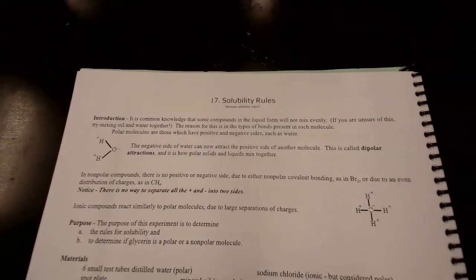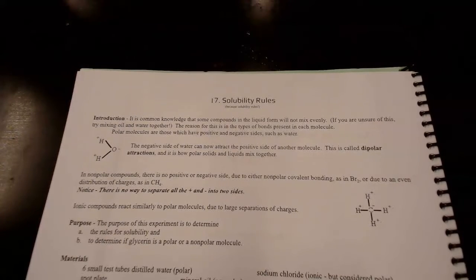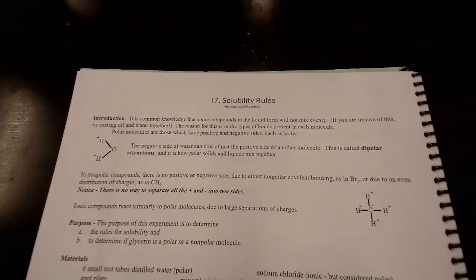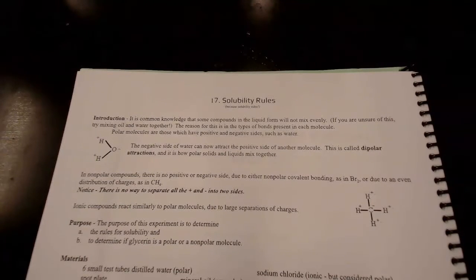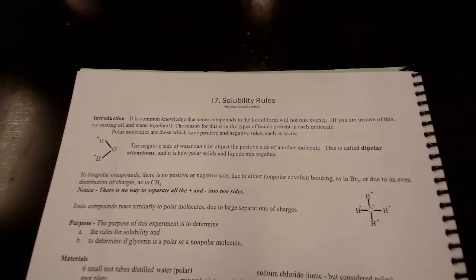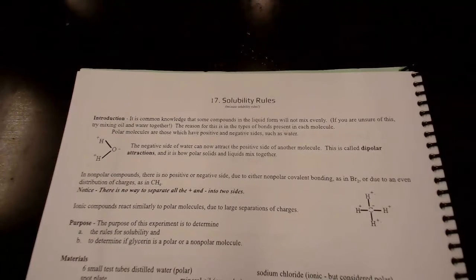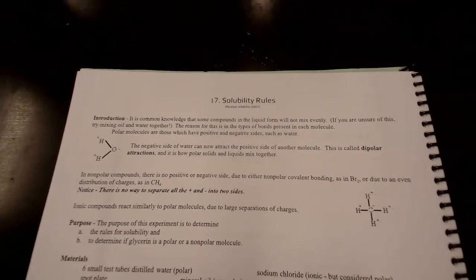Our lab today is the solubilities and rules lab. What we're doing is trying to find out: do polar and nonpolar things mix, do polar and polar things mix, do nonpolar and nonpolar things mix, and then we're going to determine if the chemical glycerin is polar or nonpolar by applying the rules.